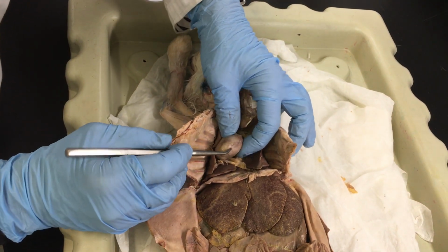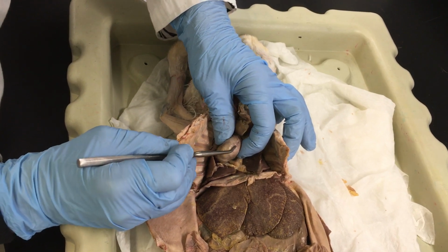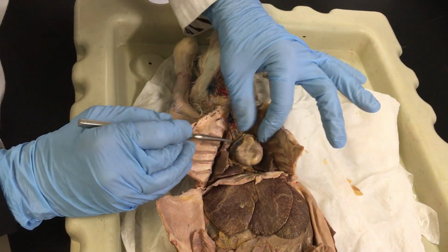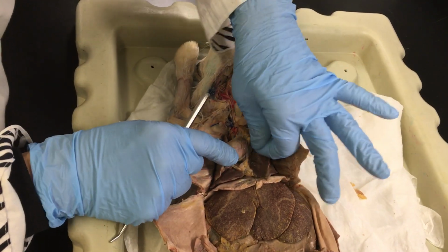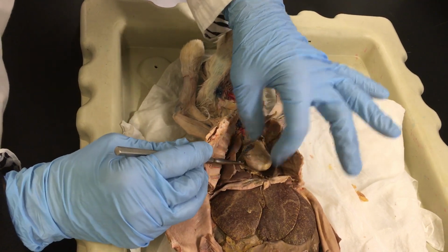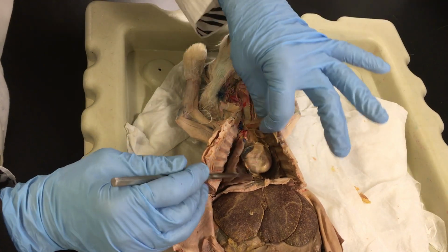The membrane on the heart is the visceral pericardial membrane, or visceral pericardium, which is hard to detach because it's really all adhering onto the muscle itself. So again, the pericardial cavity has the parietal pericardium and the visceral pericardium all around. We will get back to this with the circulatory system.